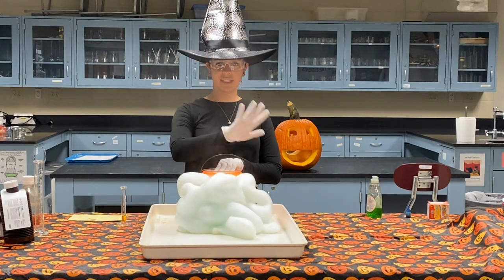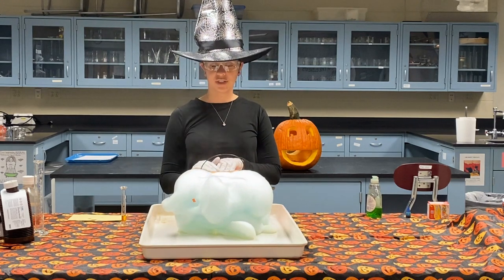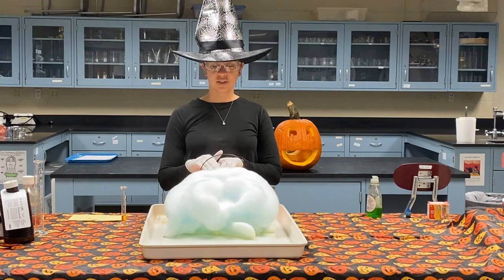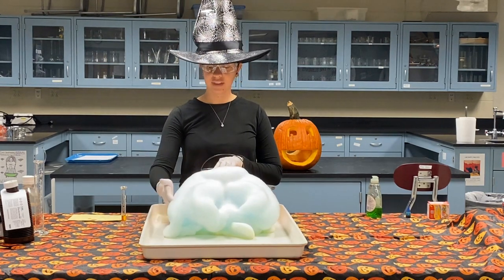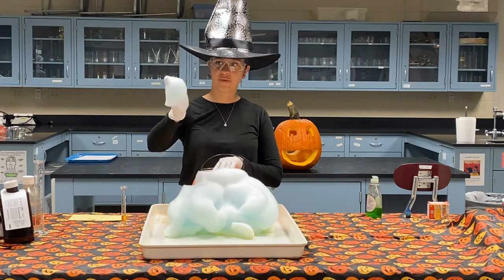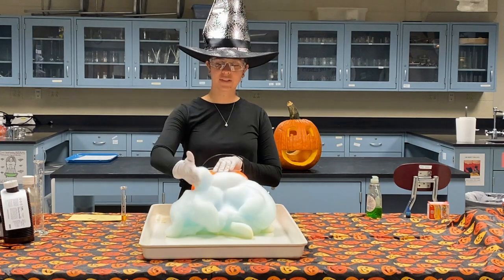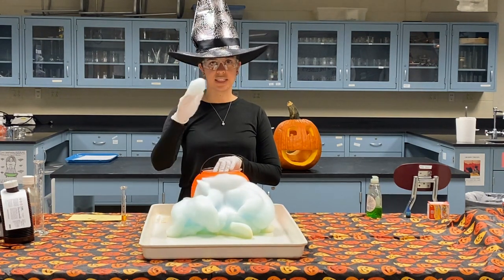Now, you may not be able to see necessarily in the video, but there is a lot of steam coming off of this, which should tell you once again that this is a very exothermic reaction. So it's giving off a lot of heat. You can see our foam here. And again, it is just sort of bubbles there, and what's happening is that oxygen gas is trapped in the soap, creating those bubbles, and we get this nice foam effect.